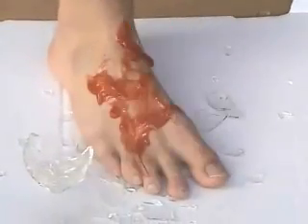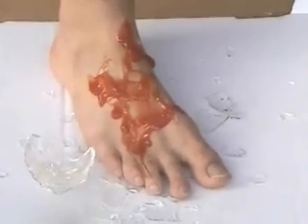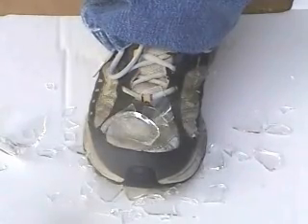Oh my foot! Derek decided not to wear shoes in the laboratory, and look where it got him. Kevin, on the other hand, decided to wear shoes, and he still has full use of his feet.